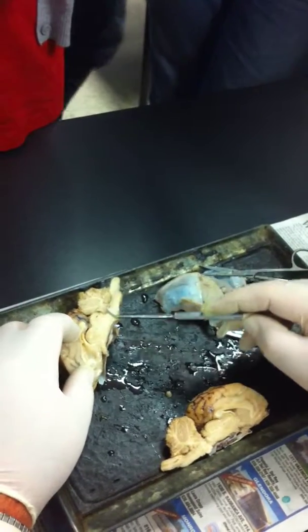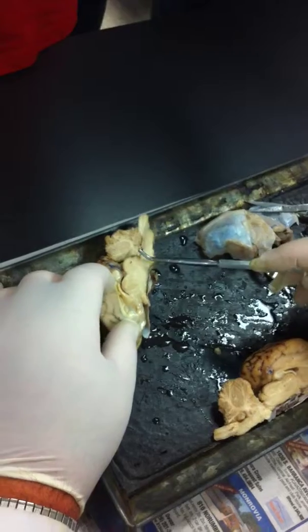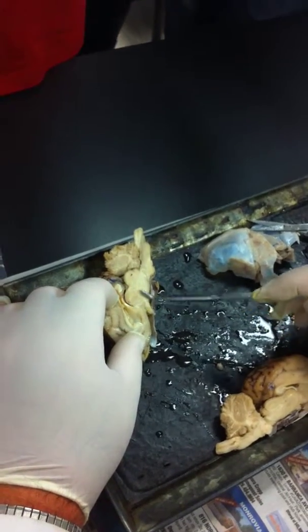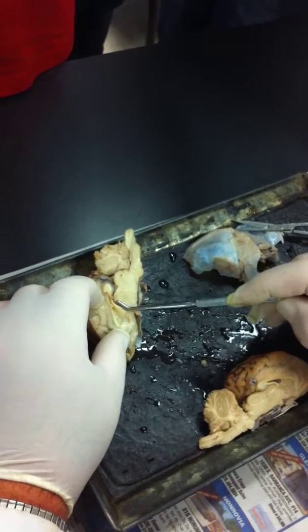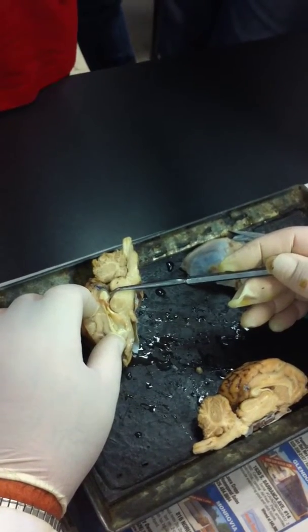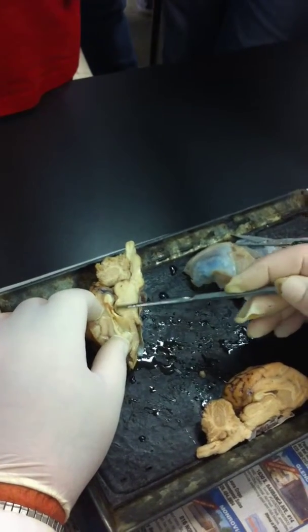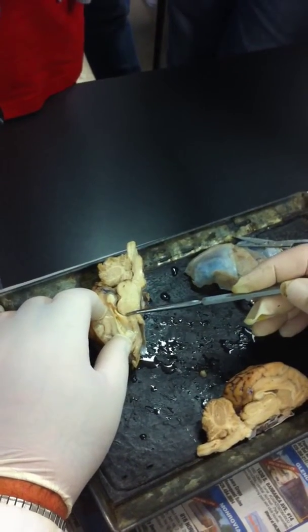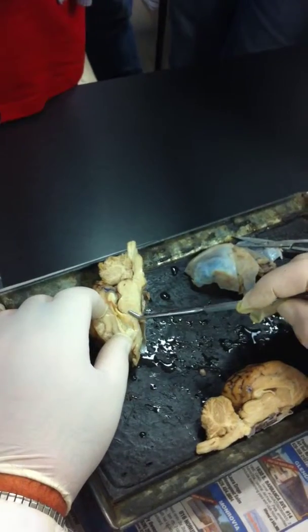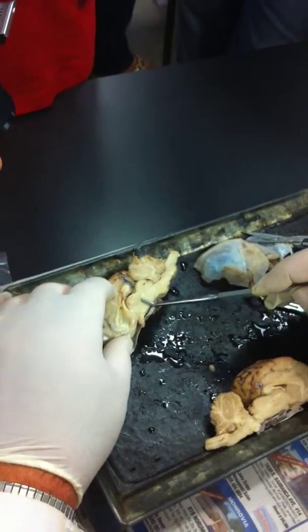Okay, so brainstem up to here. And then this region here is the diencephalon, and it includes, remember, the pineal gland that's in the epithalamus. Okay, then see this round mass here? This is the thalamus. And then below that is the hypothalamus.